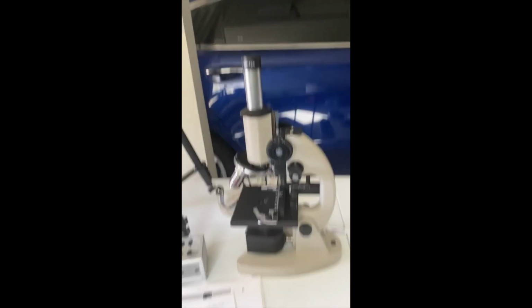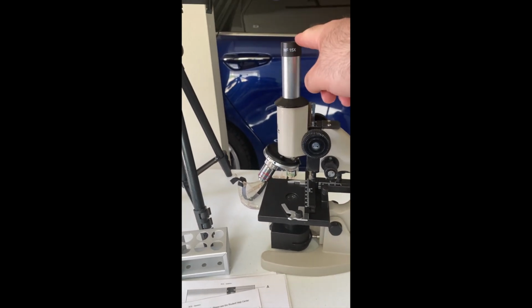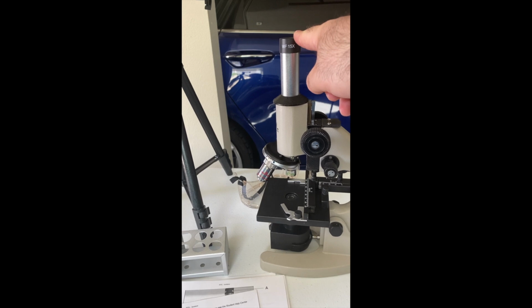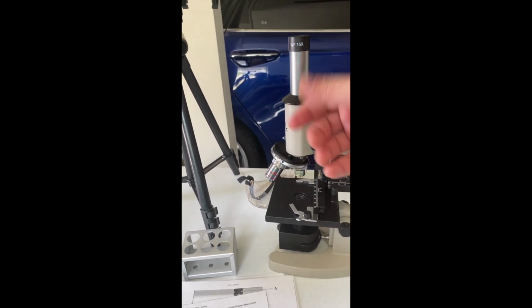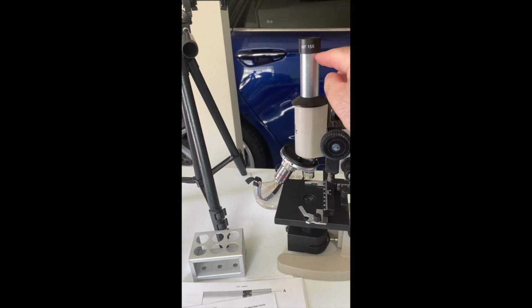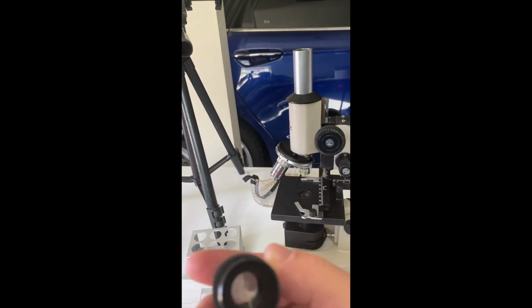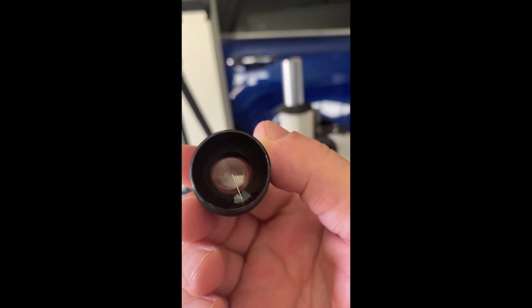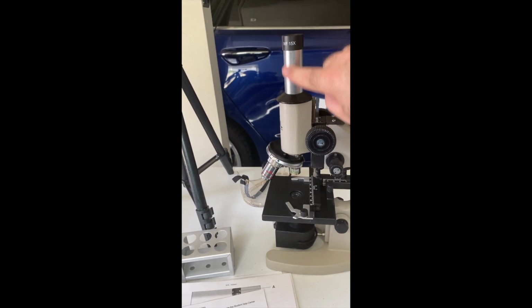All right, so anatomy of a microscope. This is my eyepiece here. This is what I look into, basically down this way, all the way here, so I can see what's going on. There is a slight magnification here, as you can see, of 15 times, and there's a little pointer in there that helps identify things when I'm looking into them. So this is the eyepiece tube.